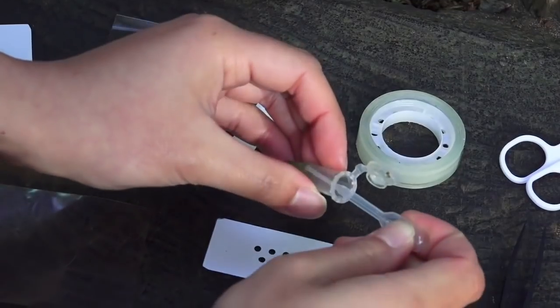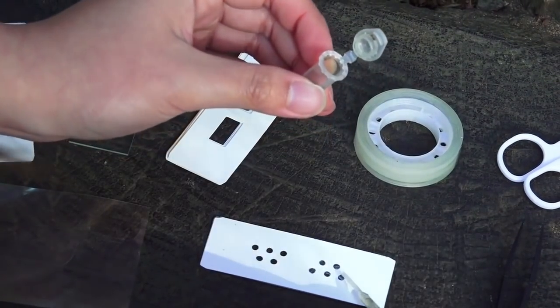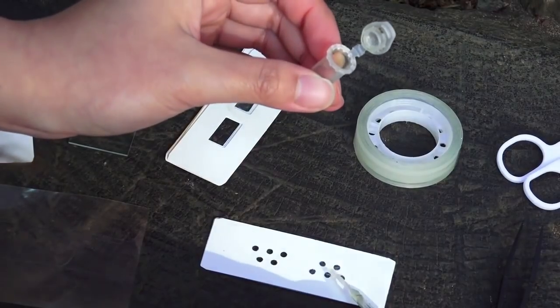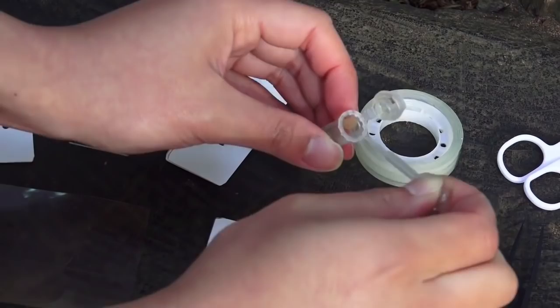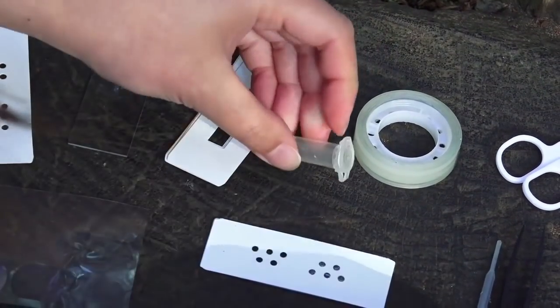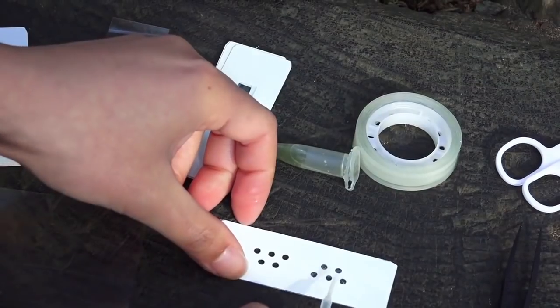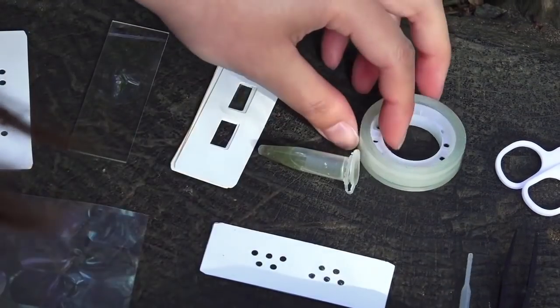And you can take a little bit of water sample with a dropper like this and then place them just a tiny bit. A tiny bit goes a long way on the micro wells. And you might even want to spread that around a little bit.